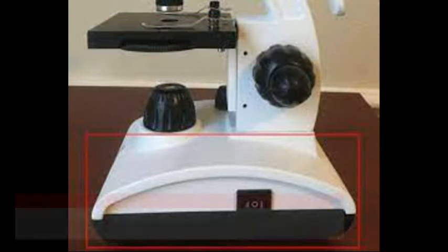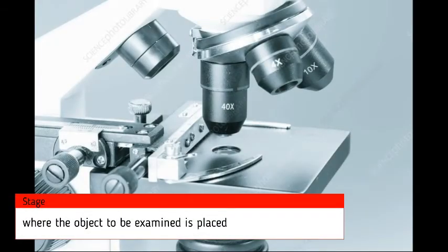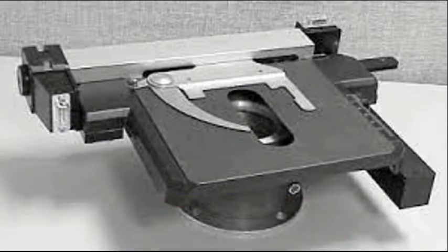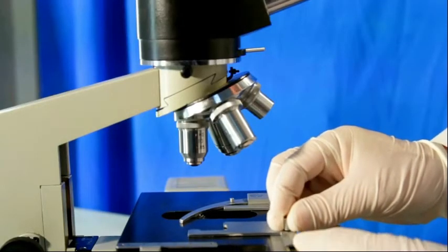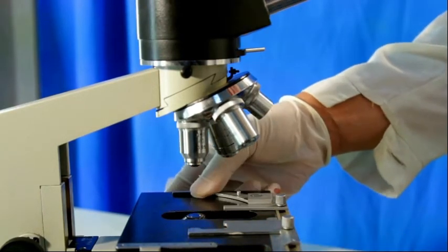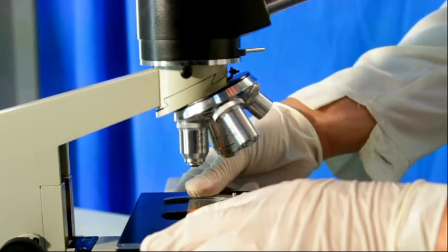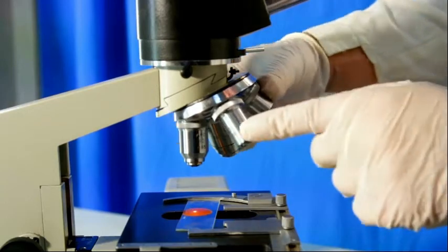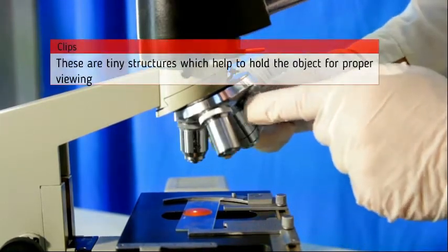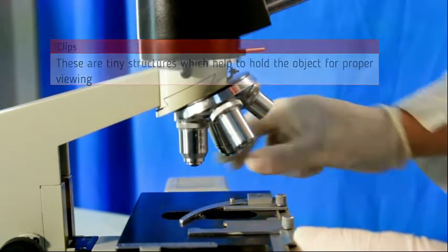The stage is the part where the object to be examined is placed. The clips are tiny metal structures which help to hold the objects on the stage for proper viewing.